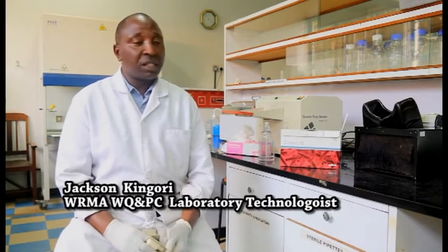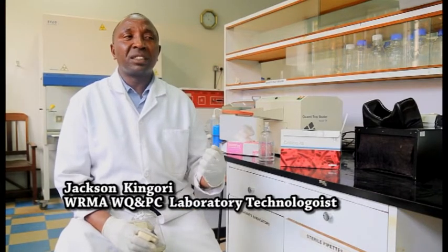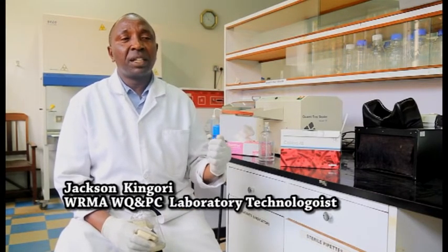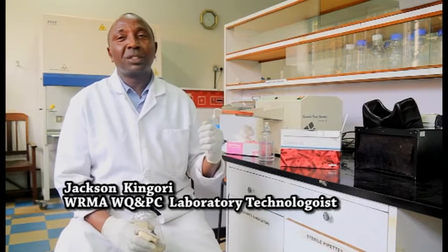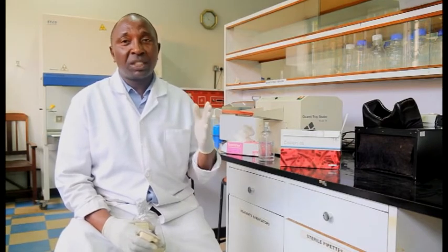So the test that we have just performed, for example, currently we are using a different method. Initially we were using what is called the multiple tube fermentation technique, but that method is still good, but now we are using a more efficient and faster method, which we refer to as the defined substrate technique.